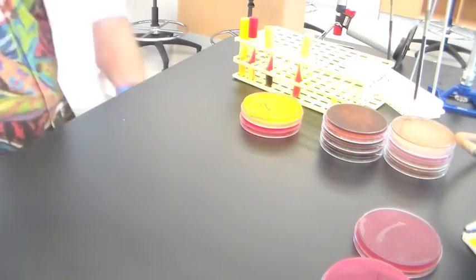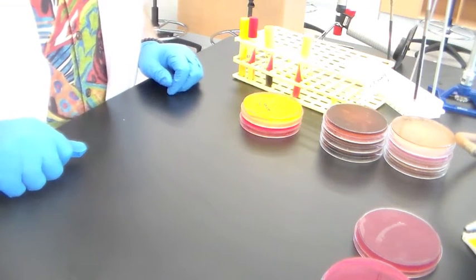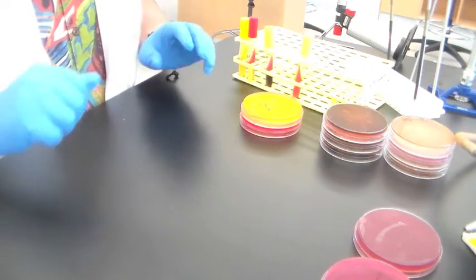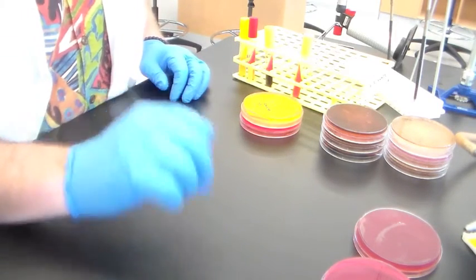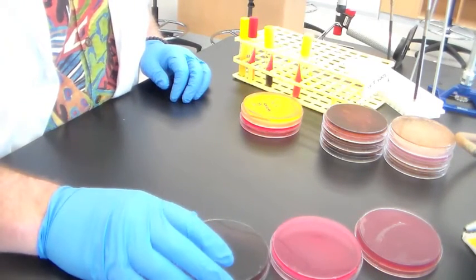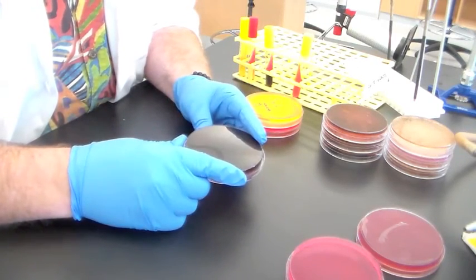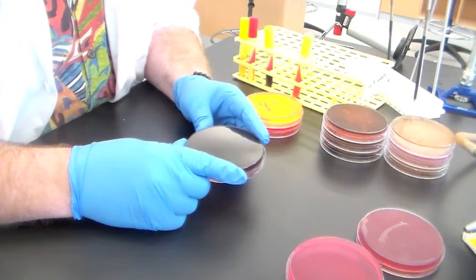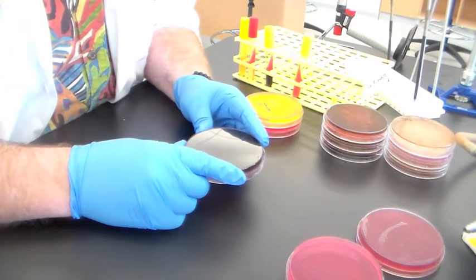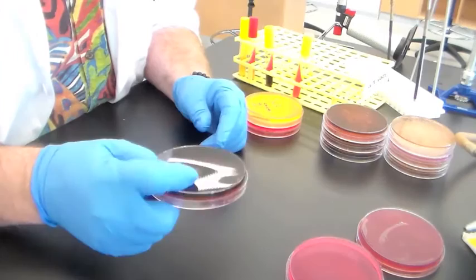This week for the pre-lab video, let's talk about the media that you inoculated before fall break. It's been sitting in the refrigerator waiting for you. I want to introduce the principle of selective and differential media, because the plates that you inoculated last week with various bacterial species fit into that category.